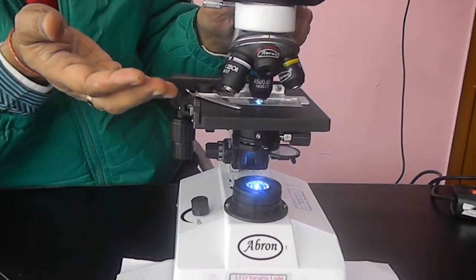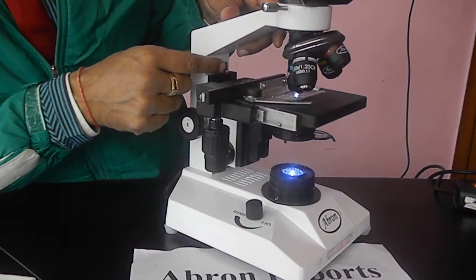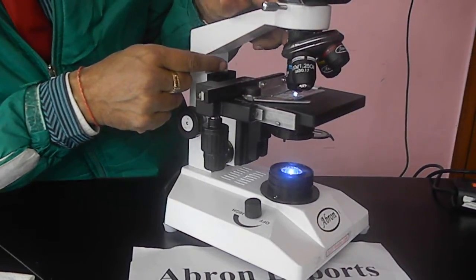And same is for 100x. This is a very good one. There is one lock. One must use it for keeping and avoiding breaking the slide.